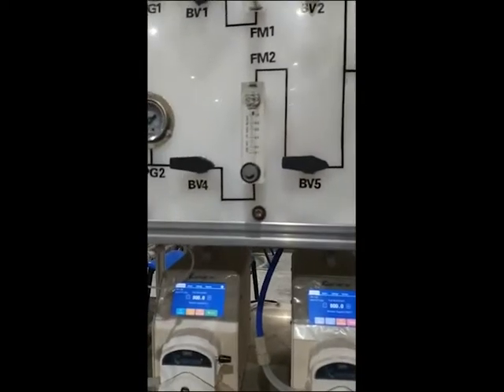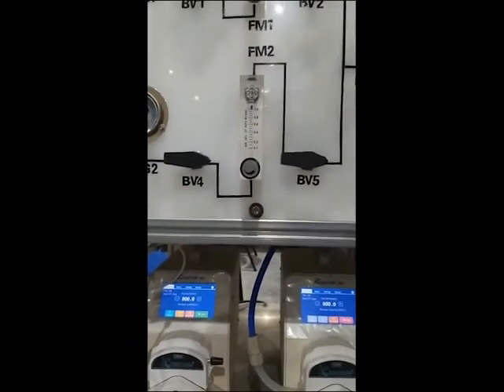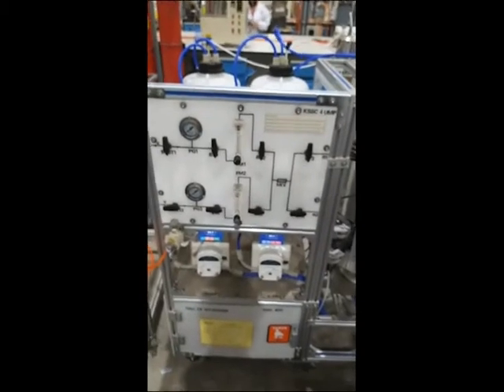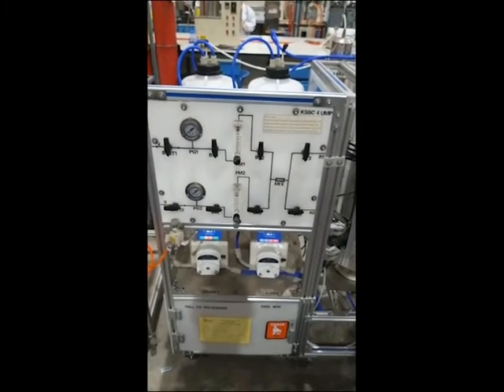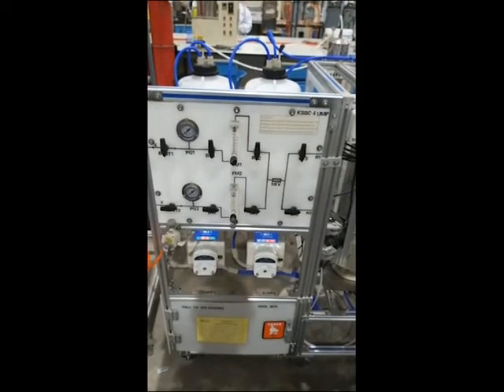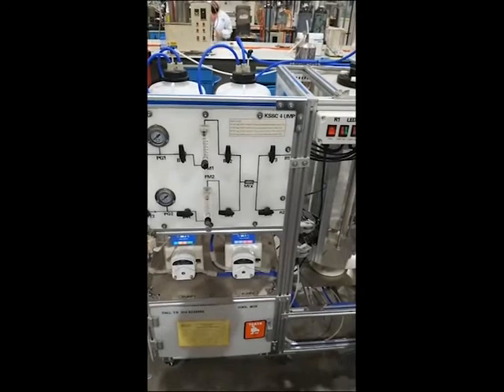After that, you can adjust your flow meter to reach your target flow value. If you have two different reactant gases, you can mix them together to make a premixed gas and lead it to reactor R1 or R2 according to your requirement.